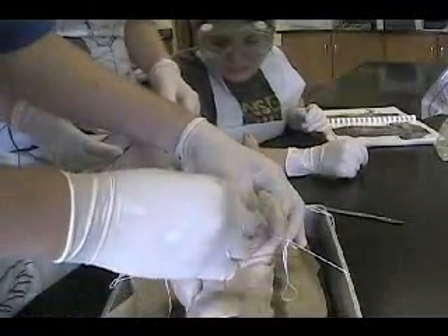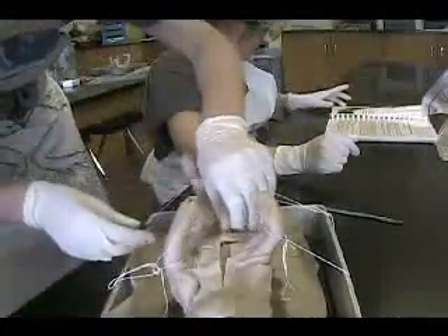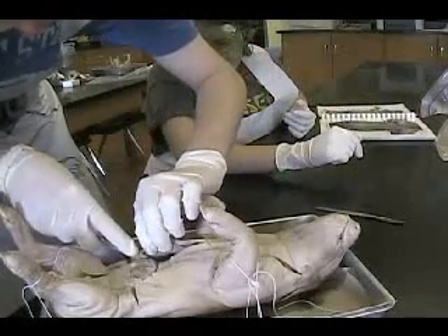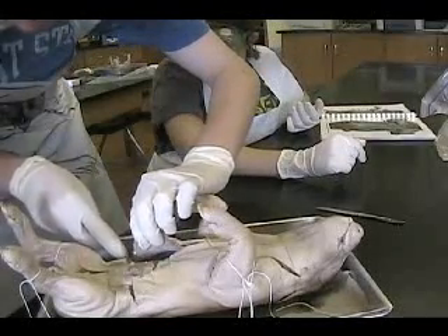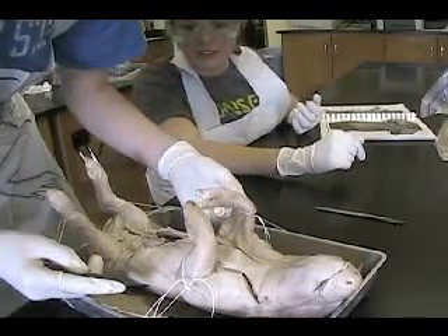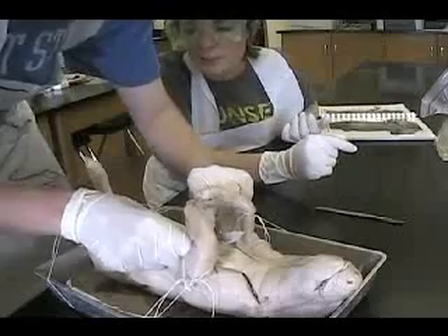And we're going to put some... Don't waste your clothes. That's because it's cooling on the outside — it's evaporating on the outside, makes it feel cool. You're supposed to separate the muscle from the skin right now, like I was doing it. You're supposed to really peel it. We're just lazy. Well, you have to put the muscle back anyway, just put it back together.